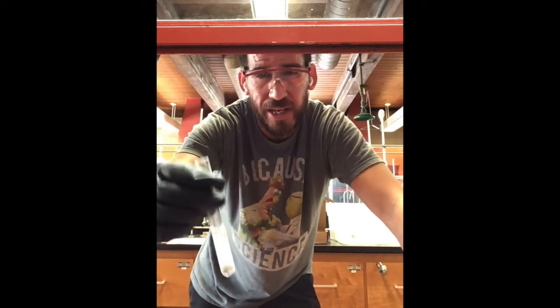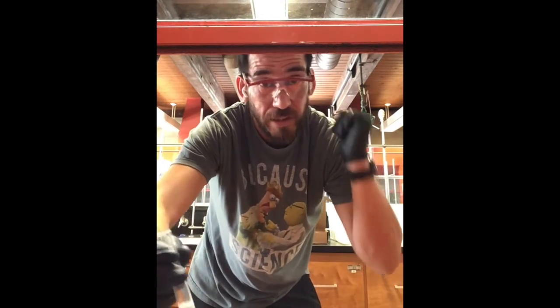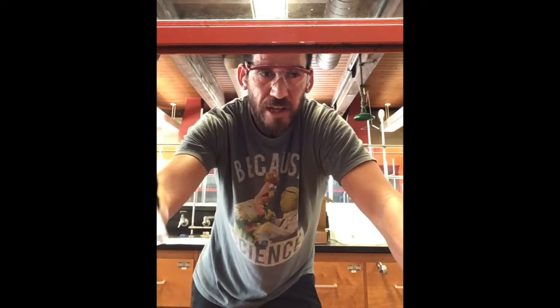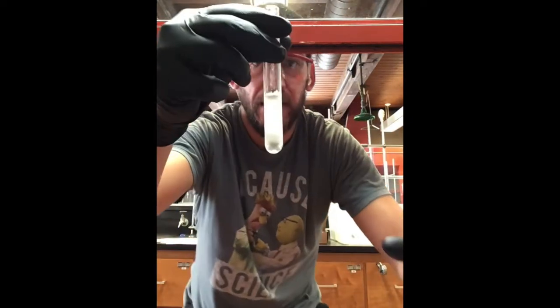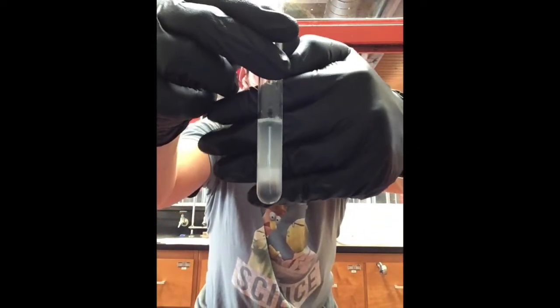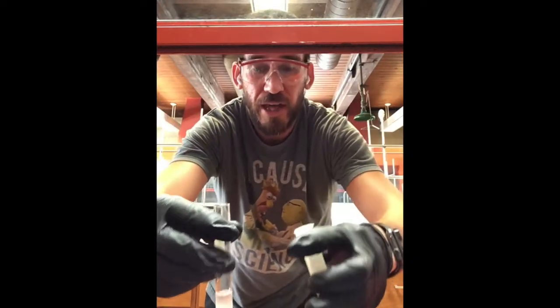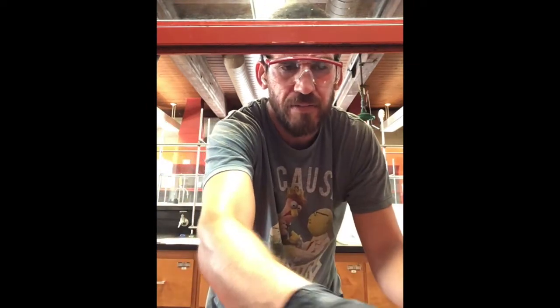separate. But one thing that we can do to make this happen faster is pour this back into the centrifuge tube and then put it into the centrifuge. And we also have to remember to balance the weight on both sides. And so I'm going to go ahead and do that with another centrifuge tube, which I have. Okay. So let's go ahead, and you can see that it's maybe clearing up a little bit, right? So if we get a little impatient, we can go that centrifuge route. But maybe we'll just wait a couple minutes, see how it goes.